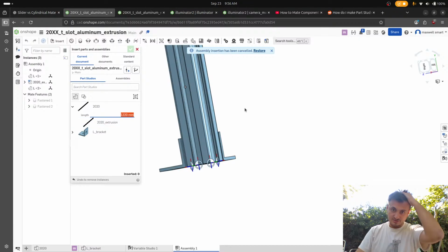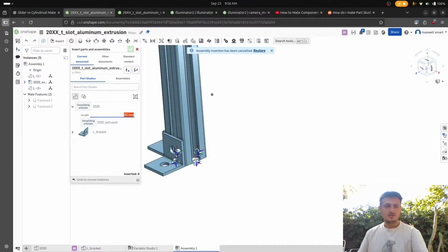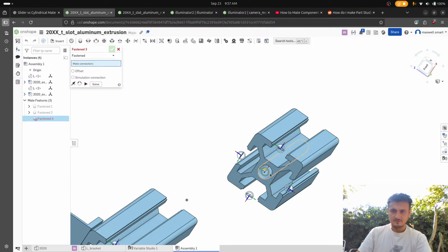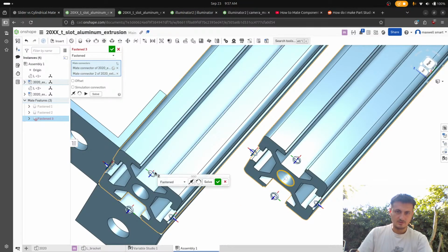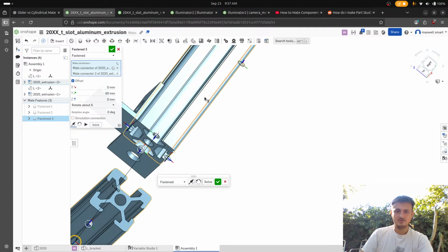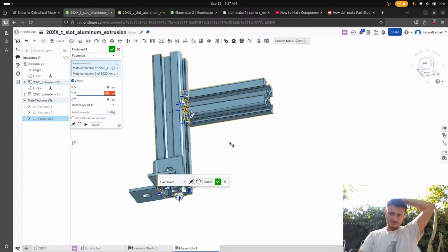So I don't know how far apart these could be, but let's just guess it's gonna be like 60. The interesting thing here is that a piece of aluminum extrusion is gonna be butted up against this thing. That's 60. All right, I don't think there's any clearance issues there. Let's do this. So we want to mate this to here, offset. Let's see, Y is that way, so let's go like 60. I don't know. And we got to reorient this. Yeah, I should fix those mate connectors. Those mate connectors stink.